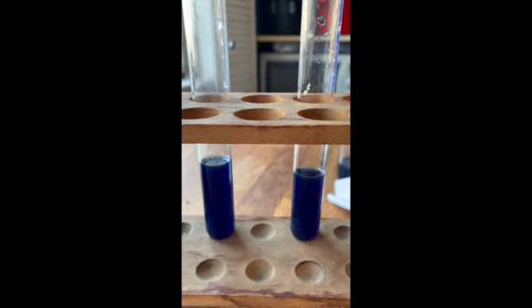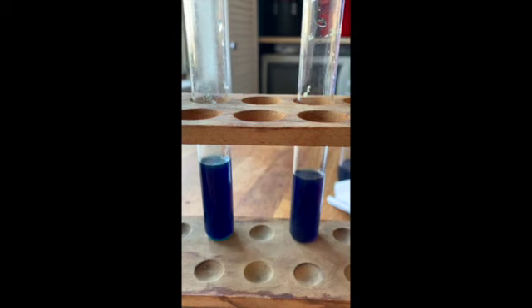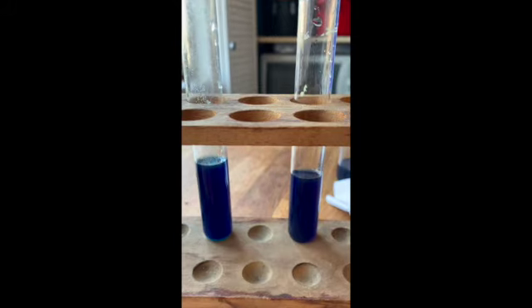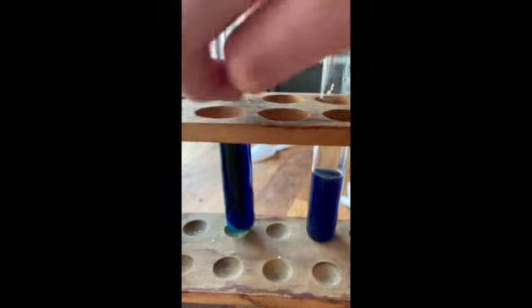We're going to take a look at our two test tubes. Maurice is putting the calcium chloride into the reaction on the left. Go ahead and take the stirring rod and stir that up — we're going to look for any color change. You can already see at the bottom that the purple is turning blue.